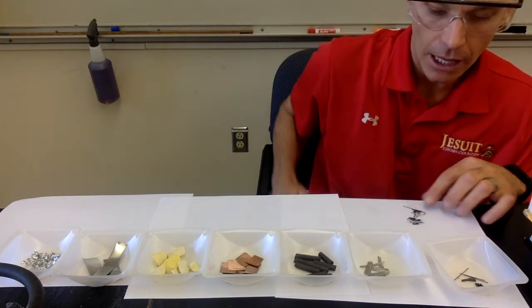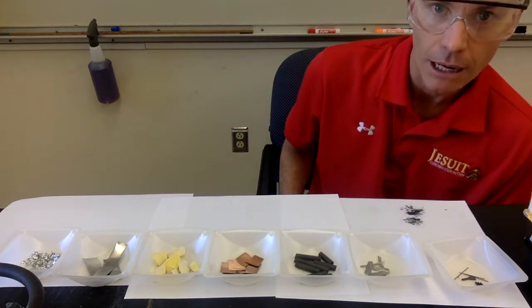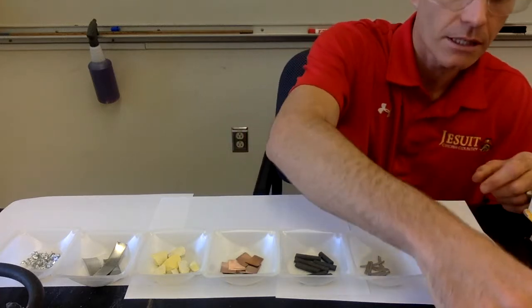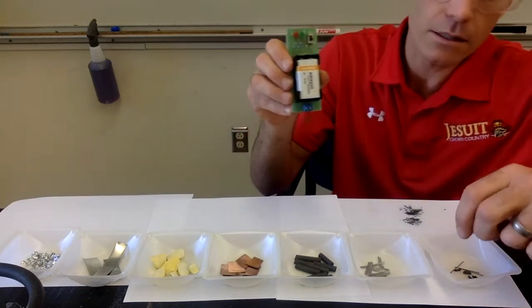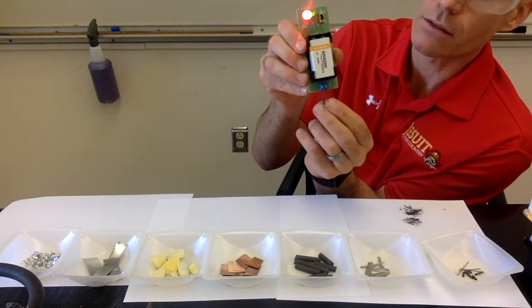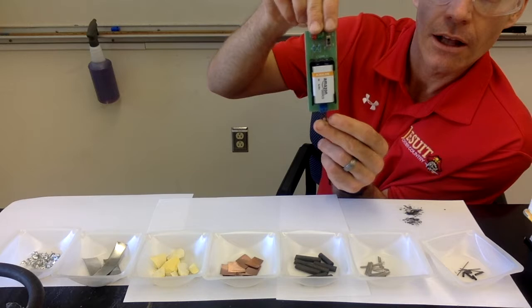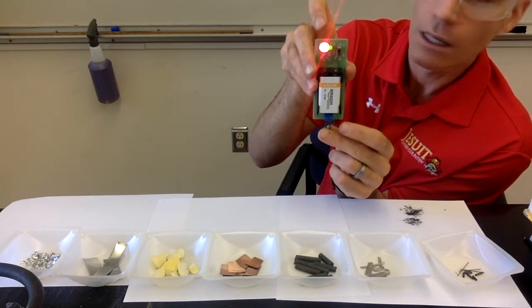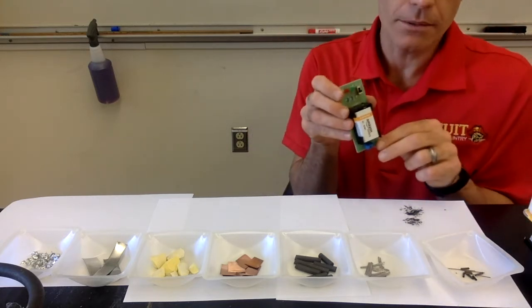And you can see that A pretty easily broke into small pieces. It got crushed into kind of a fine powder. It was very brittle and it crumbled into small pieces. The other thing I want to test with this substance is its conductivity. So this is a conductivity tester. It tells if electricity can flow through this type of material. So I'm going to hold a little piece of substance A up there, and if this light turns on, which it is turning on, then it shows us that this material does conduct electricity. Electricity can flow through this material, get to the other side, and light the light bulb. So A does conduct electricity.